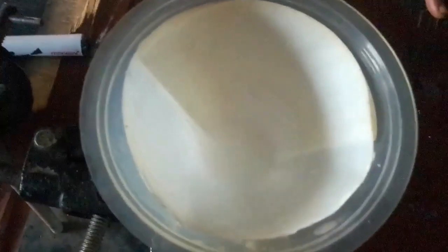So as you can observe here, this is filtration taking place. As you filter, you watch, you see the level of the mixture is going down, the filtrate is coming out from the filter paper. I add more, and as you look at the mixture, you see that the zinc carbonate is settling down. This place is thick white, while the place is somehow milky. It's showing that the zinc carbonate is insoluble in water.